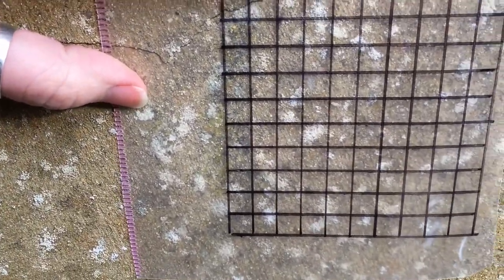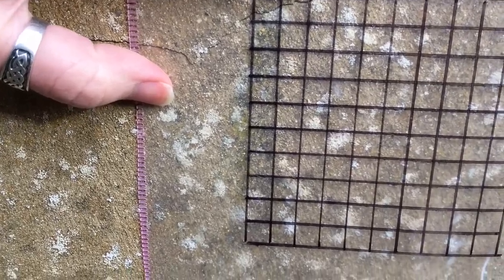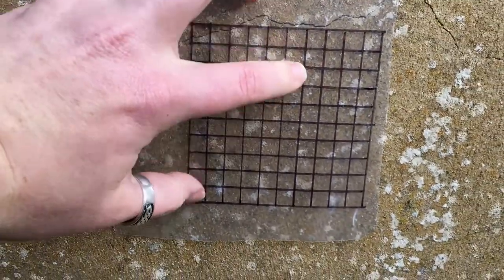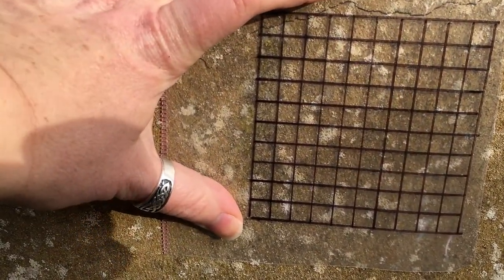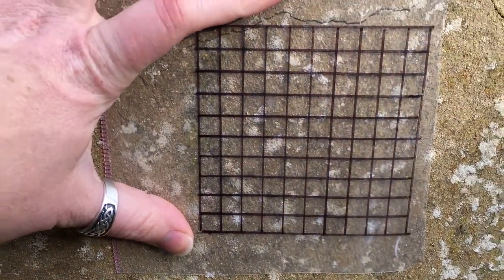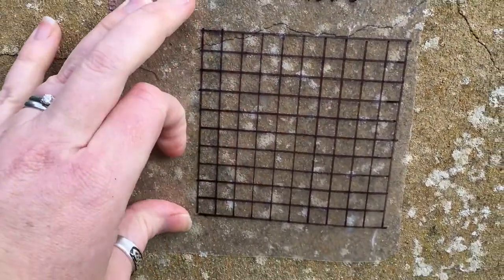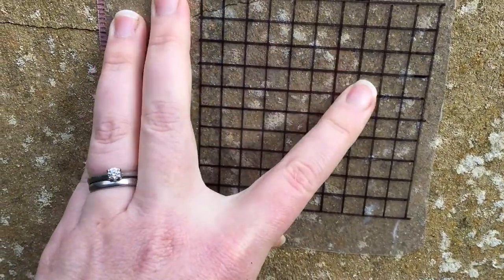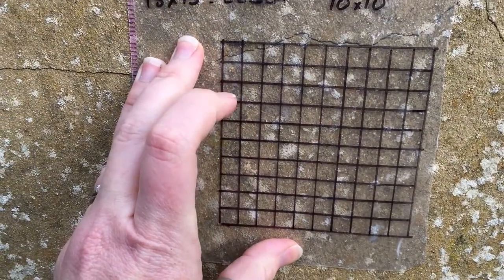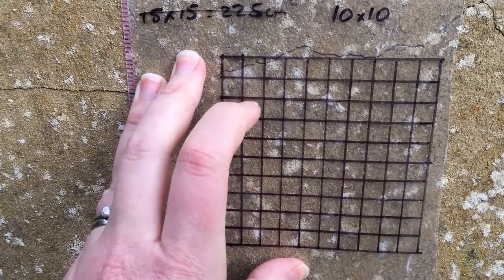Instead, what you can do when you've worked out your coordinates is place this down here and look within your square and estimate the percentage coverage of lichen. The first way that you can do that is just looking at it and going, well, it looks like it's approximately just under, let's say 20%.